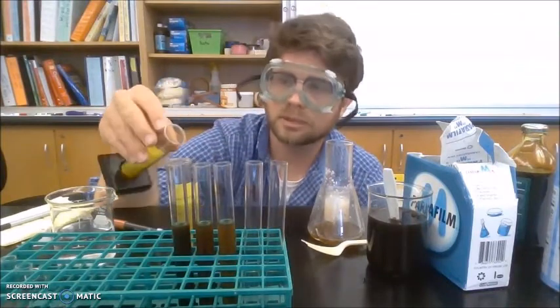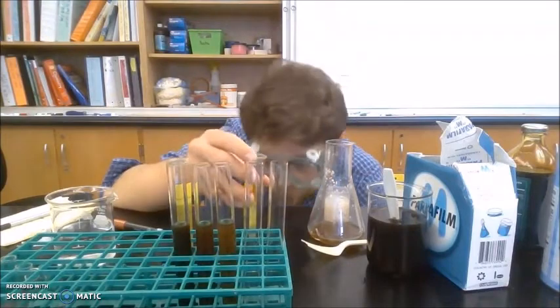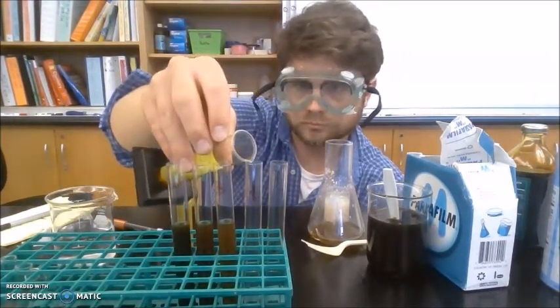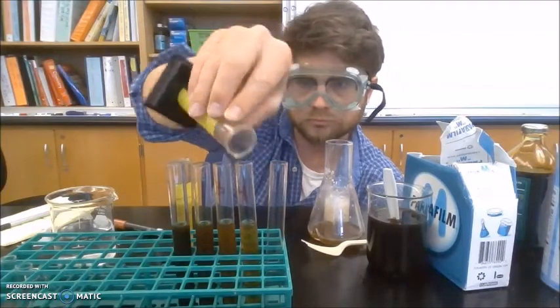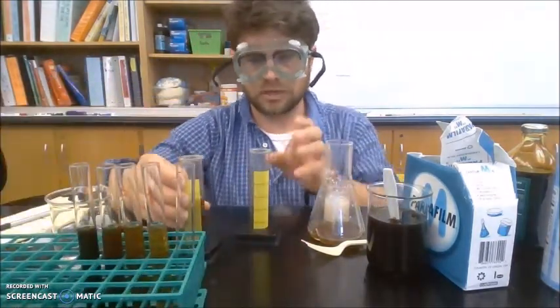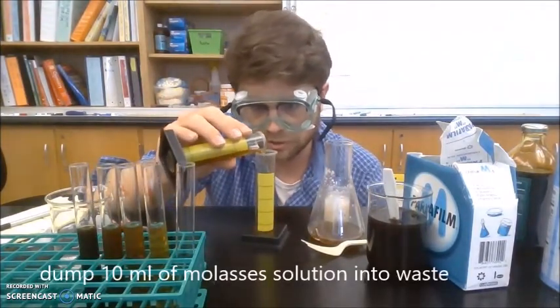I added a little bit too much. Okay, so then I'm going to dump 10 milliliters out and put it in the waste.